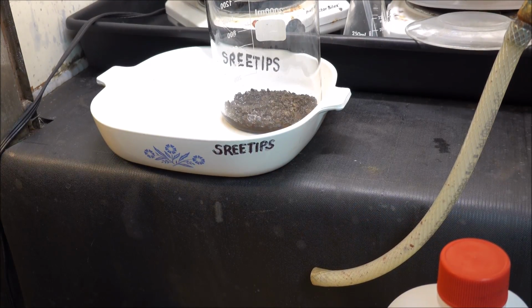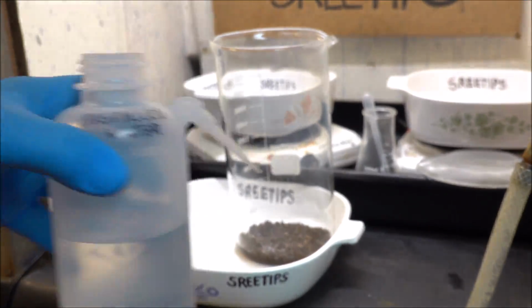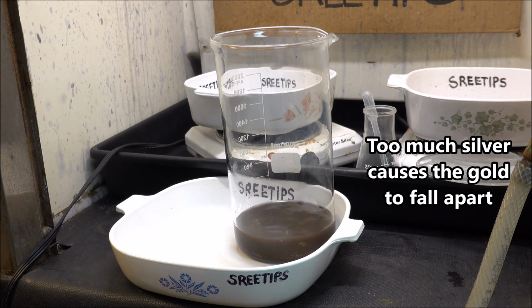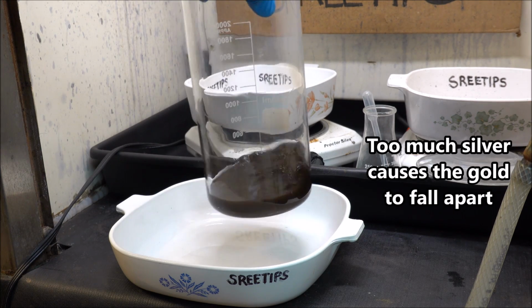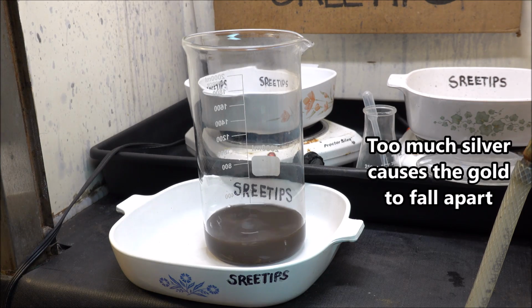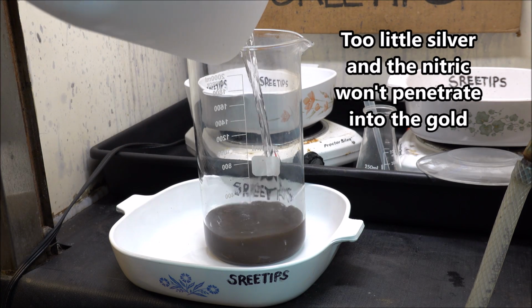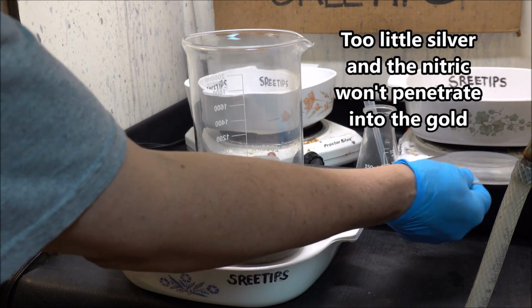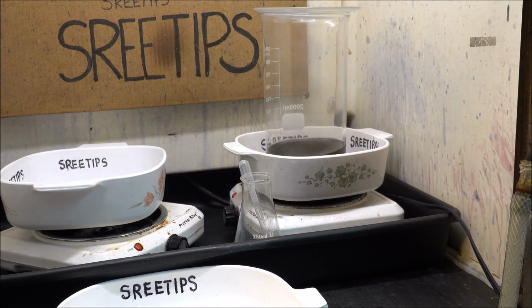What we'll do is add some distilled water to our granules up here. Notice how we get a bloom, a cloud of gold powder in there. The chunks came apart from the improper amount of silver added to it. This will be my last nitric acid treatment here. We'll put this up on the heat and let that cook and dissolve out the rest of the silver and base metals.